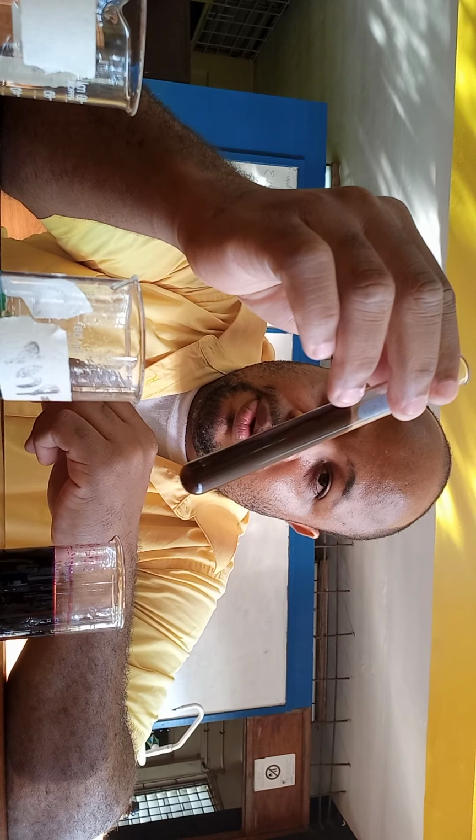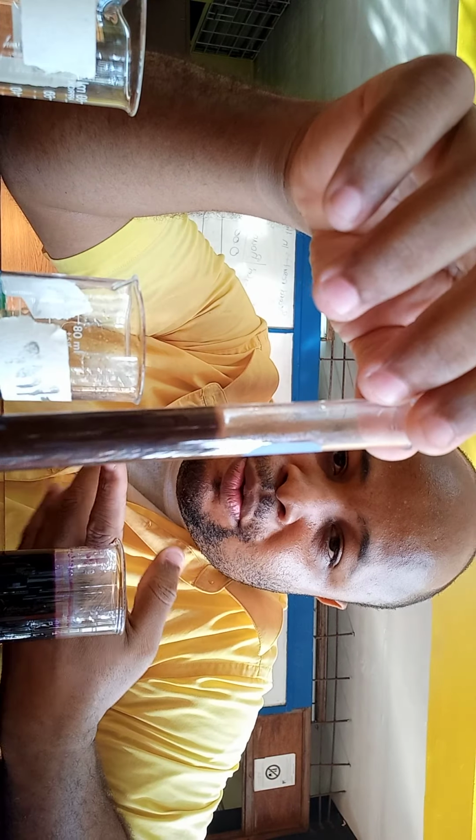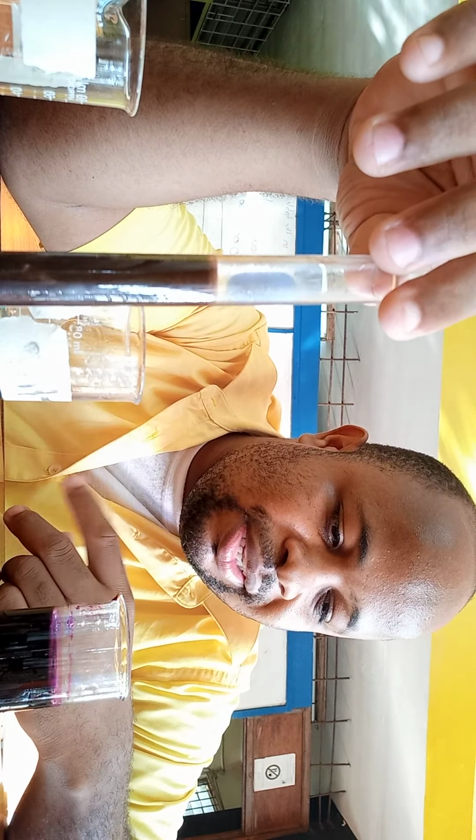Add more and see if any more fizzing occurs. Alright, so if you were doing this, because this is not in any textbook, as in following up what would have happened, now you can see what would have happened. So we see that the litmus paper doesn't really help us a lot because both of them gave us a similar change. So if you wanted to distinguish between primary and secondary alcohol, oxidizing it, in theory, and then carrying out a secondary test for the acid or the ketone can work, but in practice, it would probably take some adjustments, right?